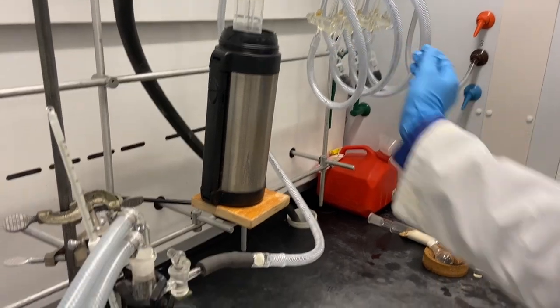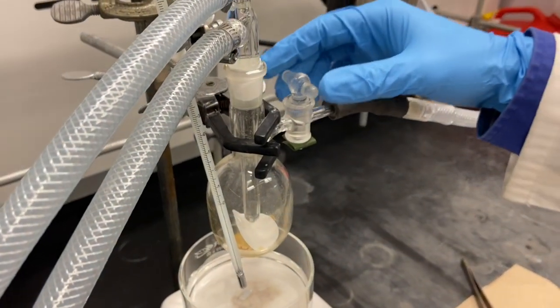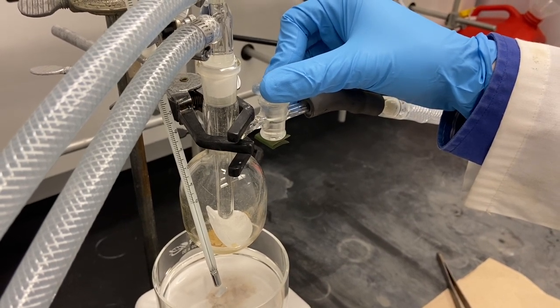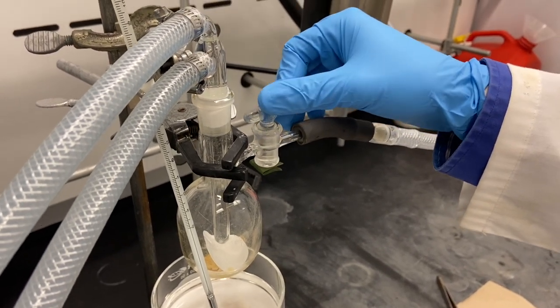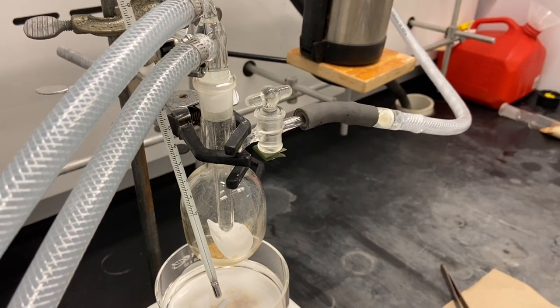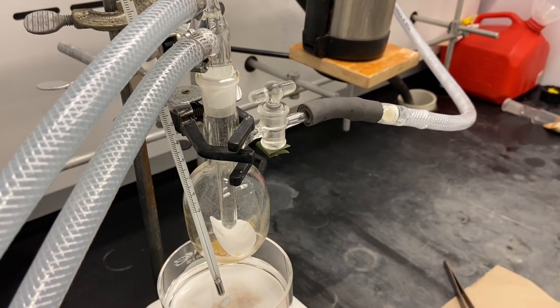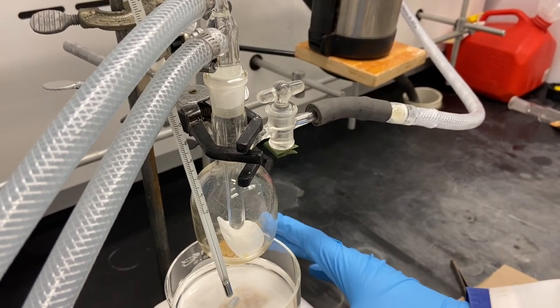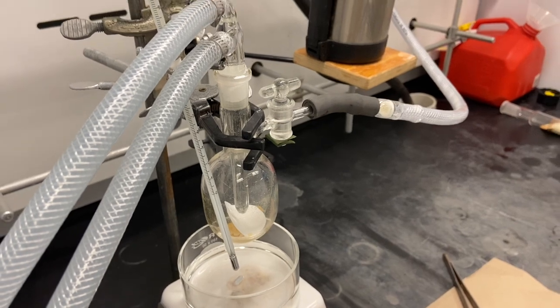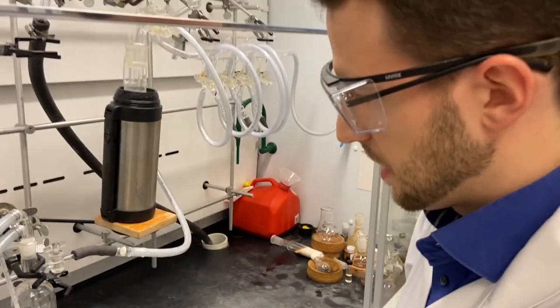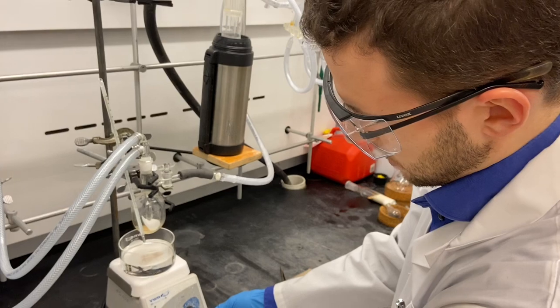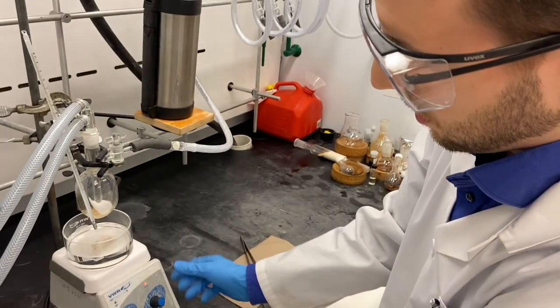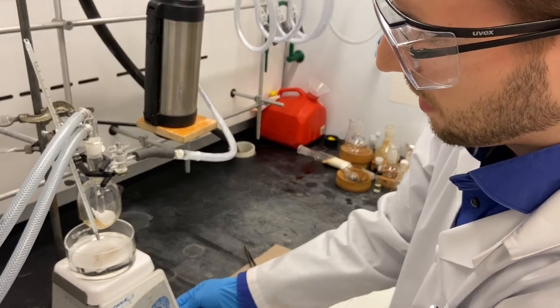We gently evacuate this whole chamber. It might be that even if you had your compound on the vacuum line for a long time, there might still be solvents in the compound. So never start with a hot oil bath as everything might start to spray up. Also in this setup we don't have a pressure meter, so we don't actually know what our vacuum is like.